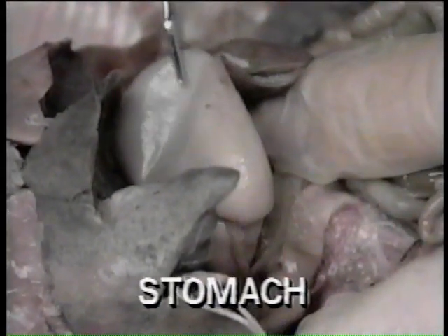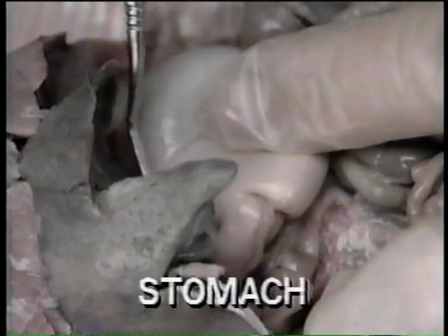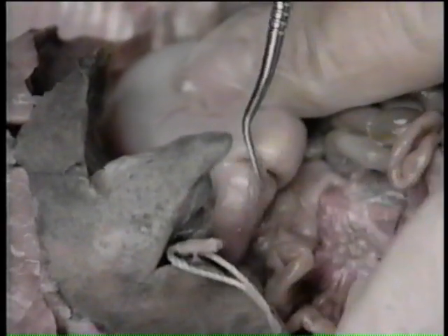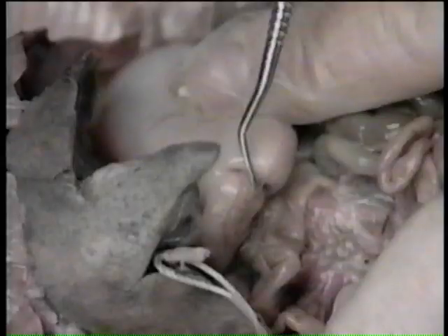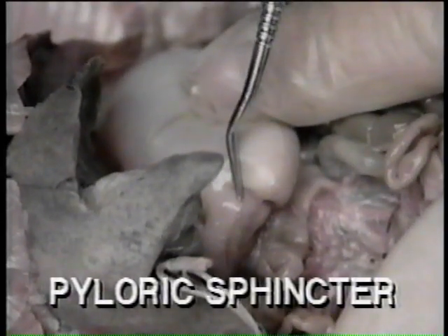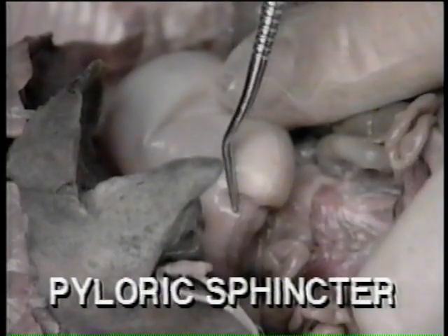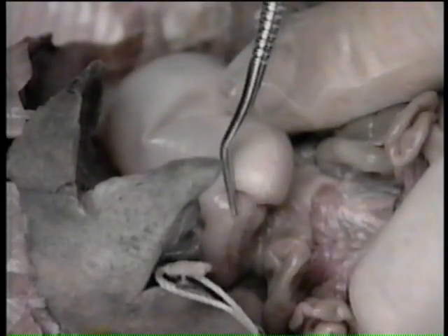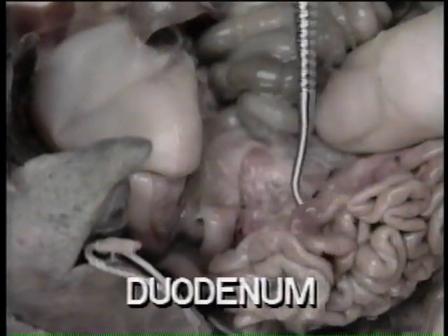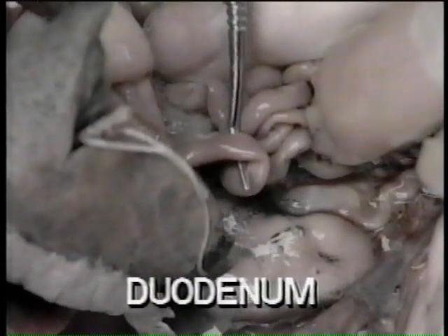Examine the stomach. The long convex border is called the greater curvature. Concave and opposite is the lesser curvature. The strong muscular ring at the border of the stomach and the duodenum is the pyloric sphincter. It serves to close off the lumen of the stomach from the duodenum, except when food is passing through. The duodenum is the first portion of the small intestine. It leads away from the pyloric end of the stomach.